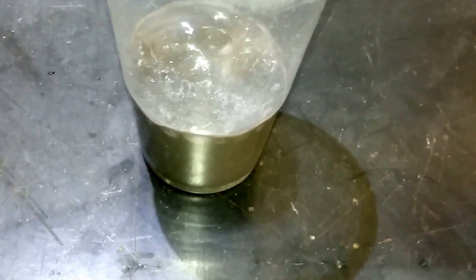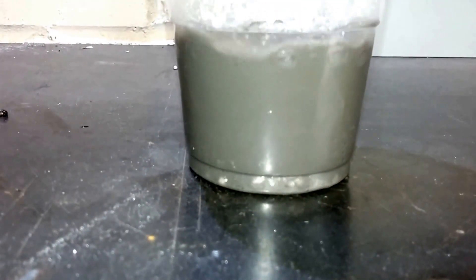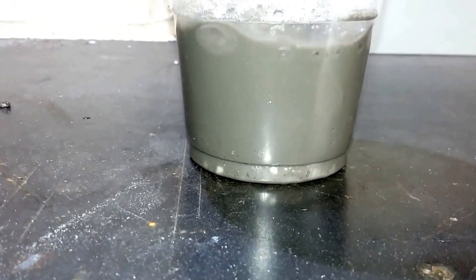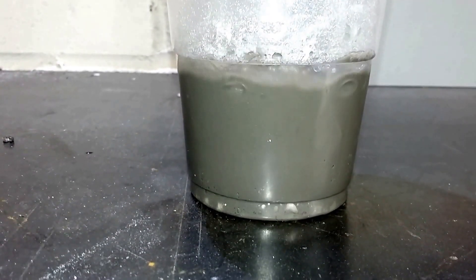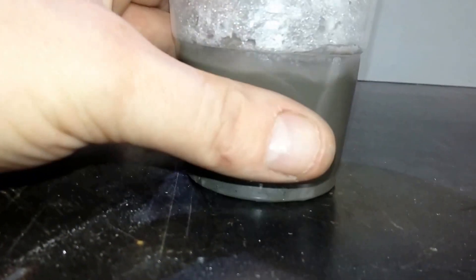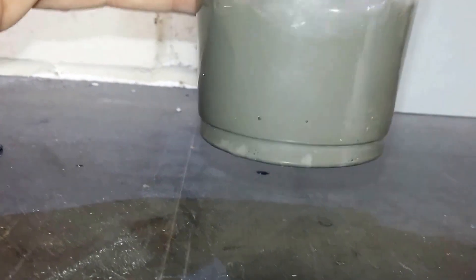Oh wow, this is producing a lot more hydrogen this time and a lot faster. And the temperature's actually increased a slight bit more.